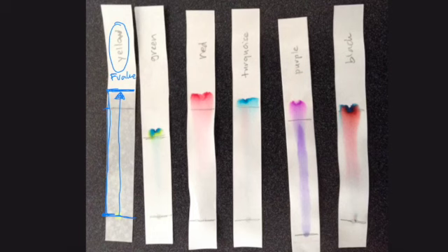So for an individual D value, for instance, let's look at red. You're putting a circle around the color spot, and then drawing a plus sign in the middle. Now this is qualitative. Some of you might have said, did I actually have to draw it all the way around there? No. Some of you might have said, I'll draw this in green, I'm only going to draw it around here, then your plus sign's going to be there. So the distance that any D value, any individual color spot, has traveled will be from the starting line to the middle of that plus sign. That's what you're going to measure using the centimeters of your ruler.